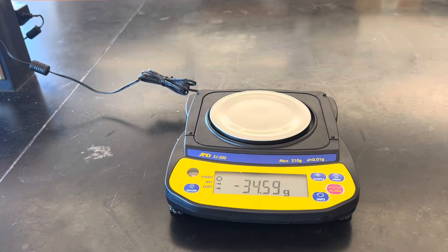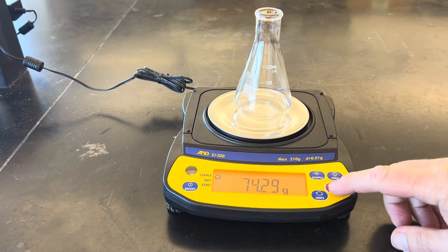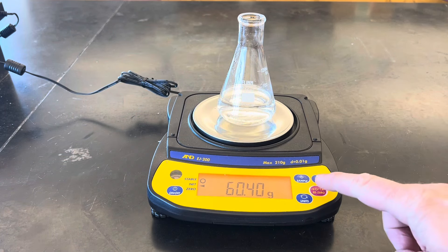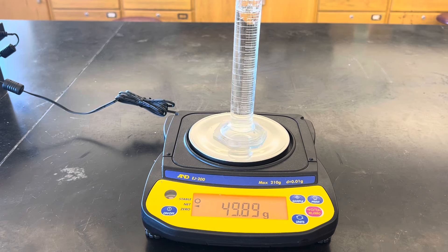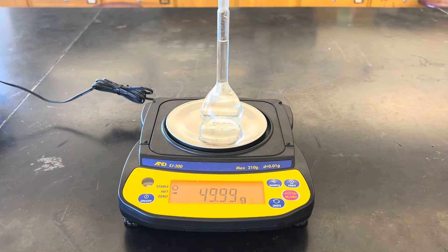Sadly, no. With the beaker, I got a mass of 46.74 grams, which is over three grams less than it should be. With the Erlenmeyer flask, I got a mass of 60.40 grams, which is even worse — actually too high. With the graduated cylinder, my mass came out to be 49.89 grams, and now we're getting somewhere, very close to 50. And with the volumetric flask, I got 49.99 grams, which is fantastically close to 50.